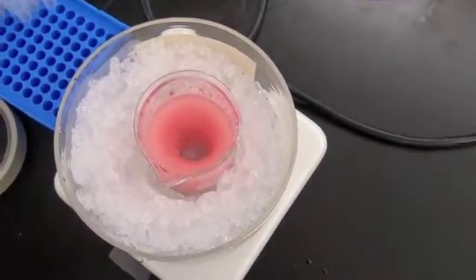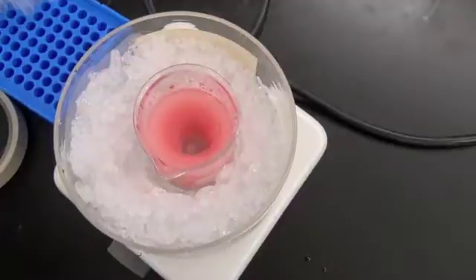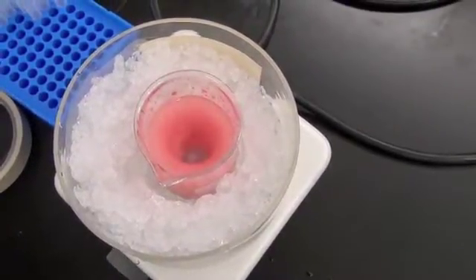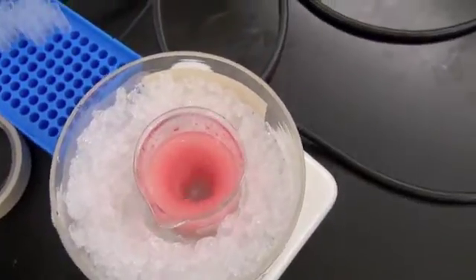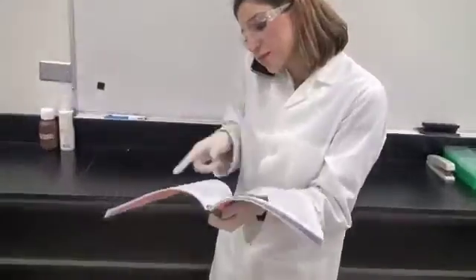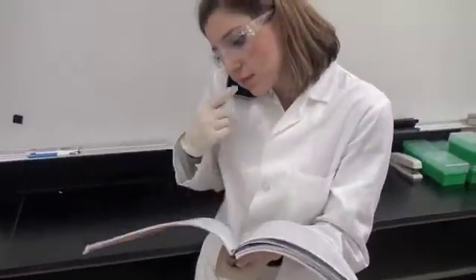This is really making me dizzy now. Me too. And this looks problematic with all the incorporation of air leading to greater chances of unfolding due to surface air denaturation. Where is she? Shouldn't she be working off her protocol?